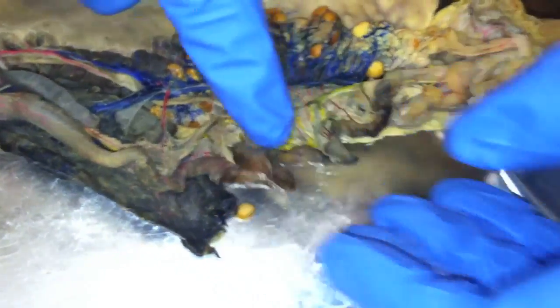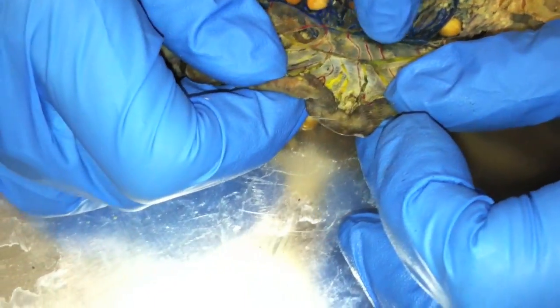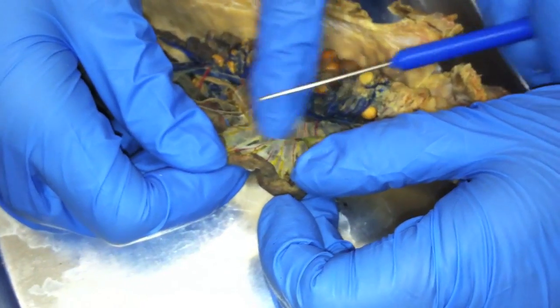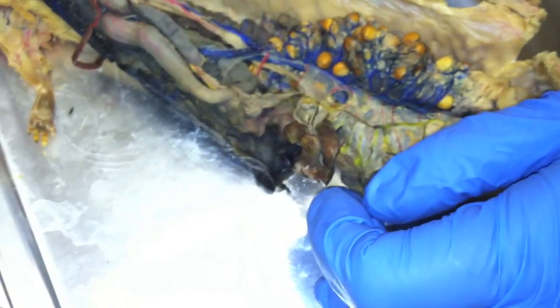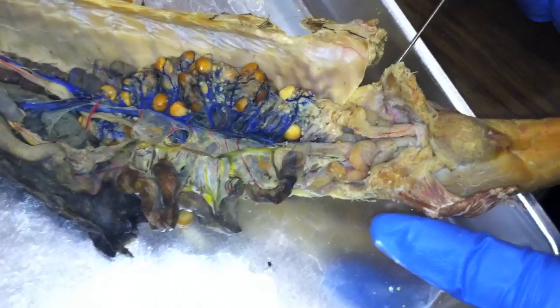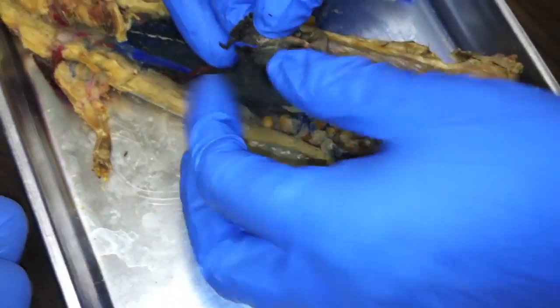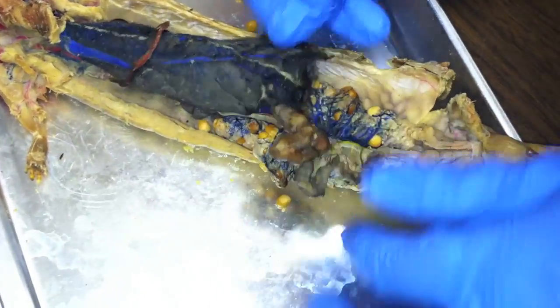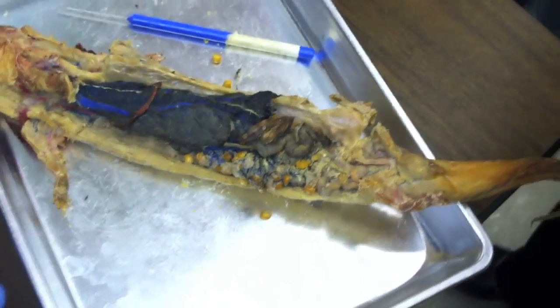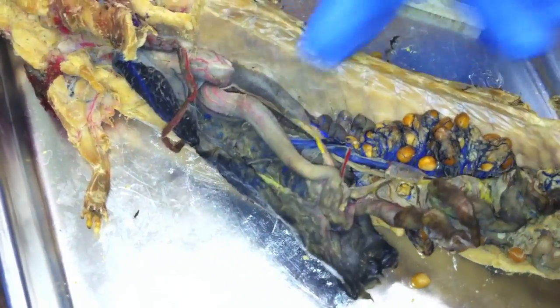All of these running here are mesenteric. The yellow ones coming down are all intestinals, and that becomes your mesenteric vein — the big one. The two pelvic veins come up and meet to form the ventral abdominal vein, and it comes in at the posterior end of the liver. And the gastrosplenic — you can see a little yellow coming along over here.